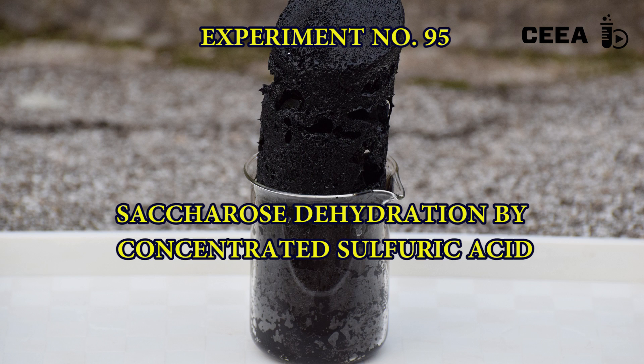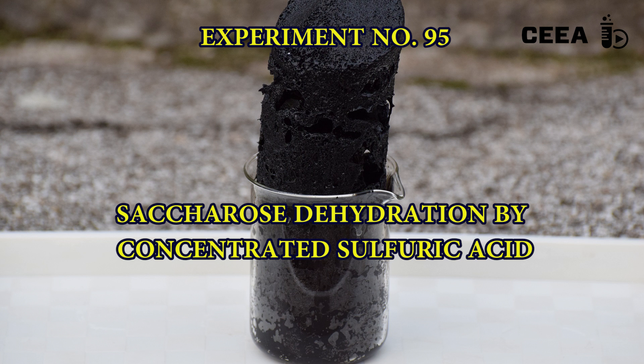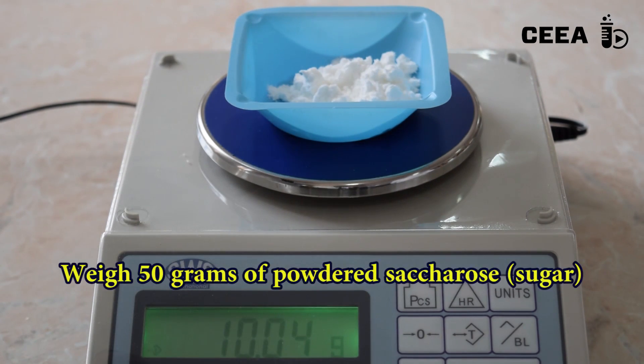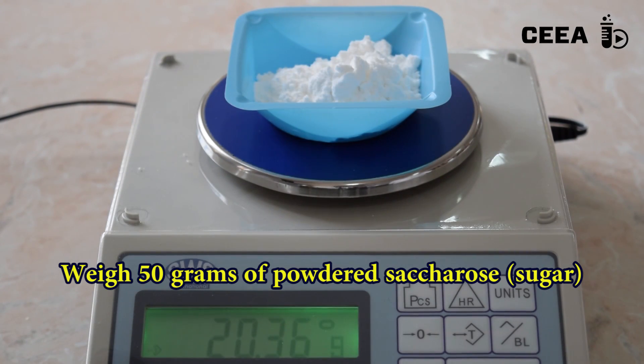the following experiment will demonstrate that strongly hygroscopic substances, like concentrated sulfuric acid, can dehydrate sugars — in this case, saccharose. Start by weighing 50 grams of powdered sugar.